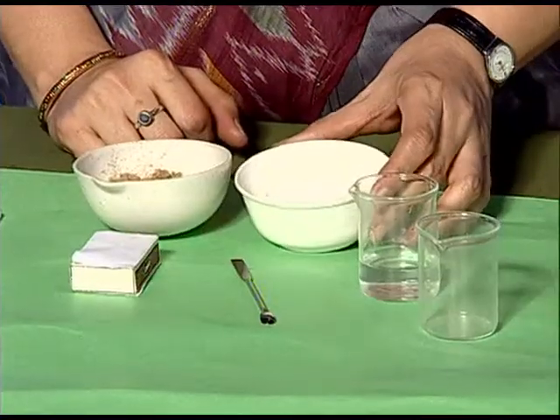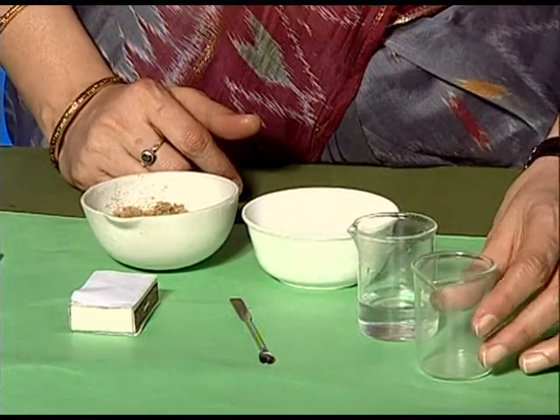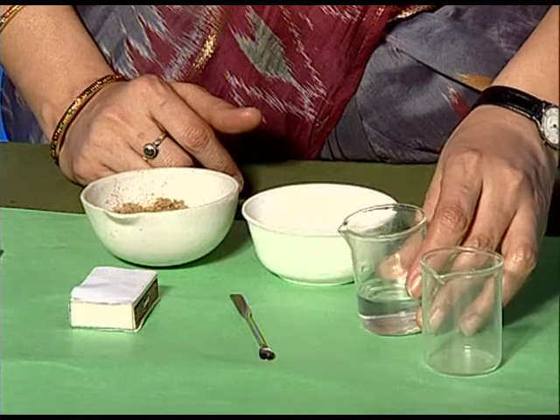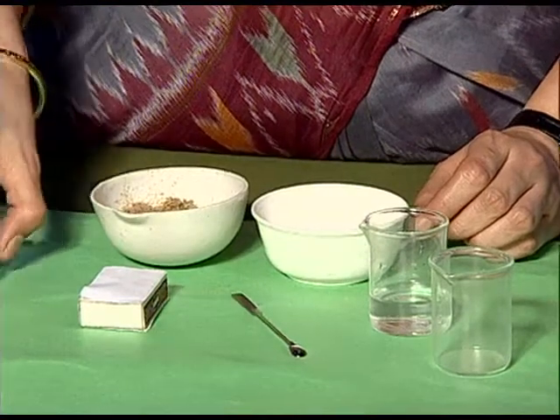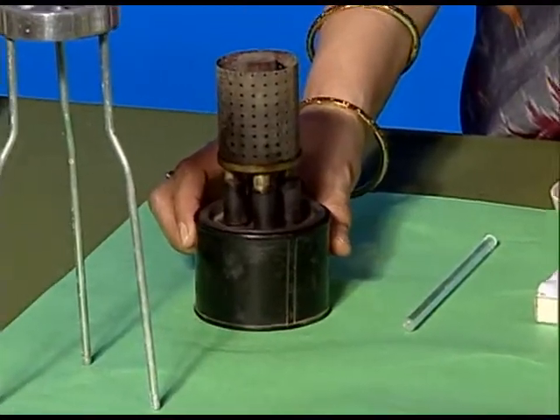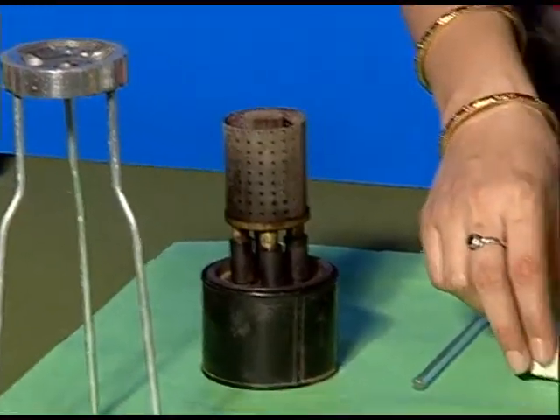In this activity, we will see how we can separate a mixture of sand and salt. For this, we require salt, sand, a beaker, water, a spatula, a glass stirrer, a kerosene burner, a tripod stand, and a matchbox.